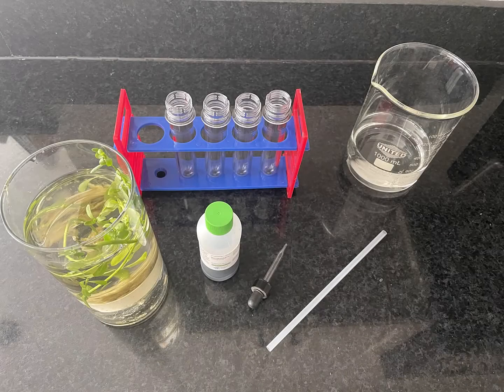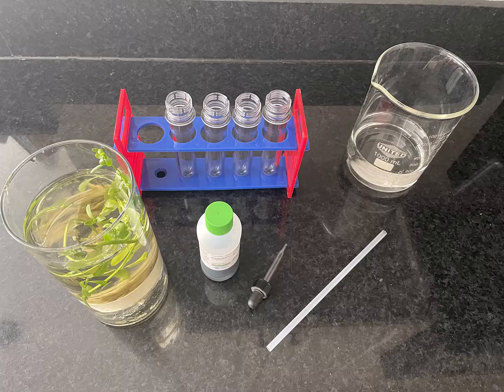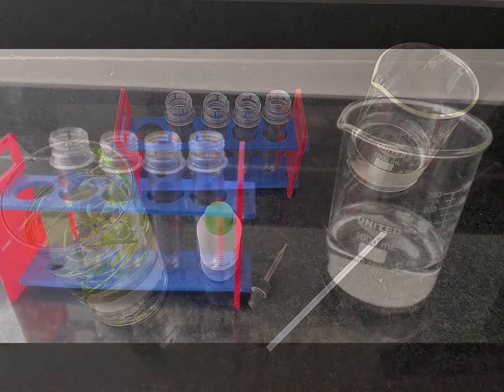For this lab, you'll need an aquatic plant, four test tubes with stoppers or caps, foil, bromothymol blue, a dropper, a straw, and a beaker of distilled water.